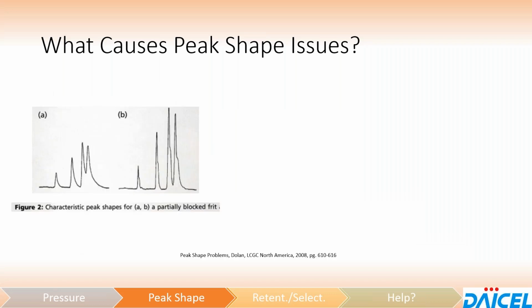So I showed this one before. This is related to partially blocked or blocked inlet frits. You can have significant peak tailing, which, by the way, can also be caused by chromatography issues, but like I said, we won't talk about those here today, or the shoulder as a result of a blocked inlet frit. But you might also see fronting or a front shoulder as a result of a void or a column collapse.